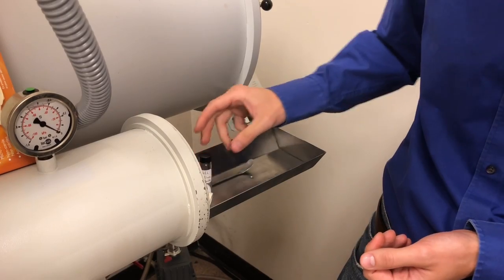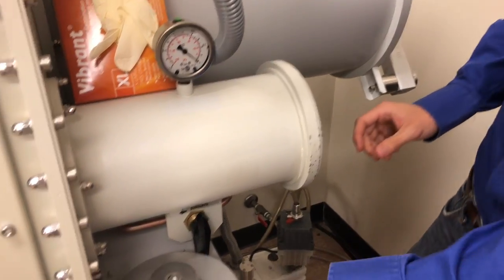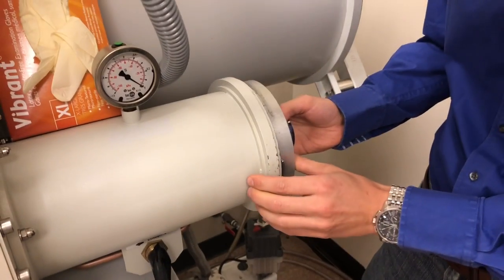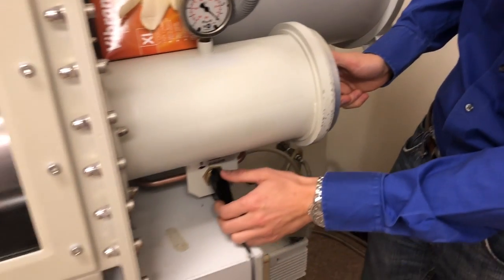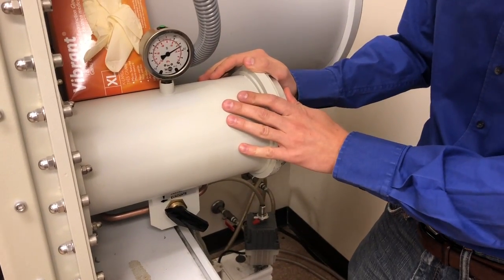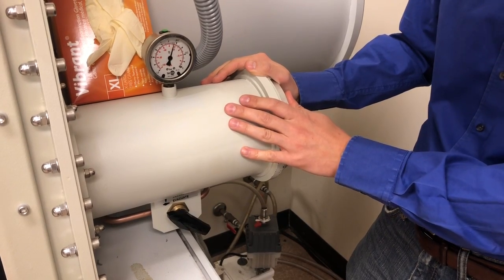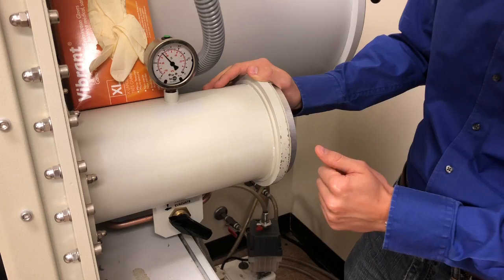You should stand it upright and close it carefully. To properly evacuate, we should wait at least 10 minutes and then come back and bring all these things inside the glove box.